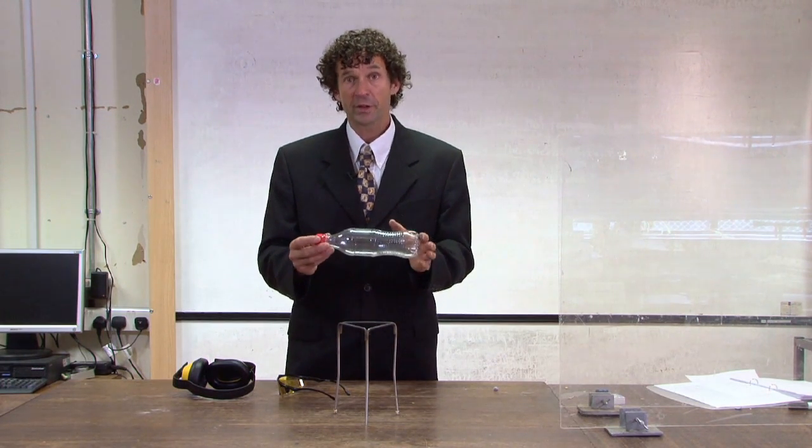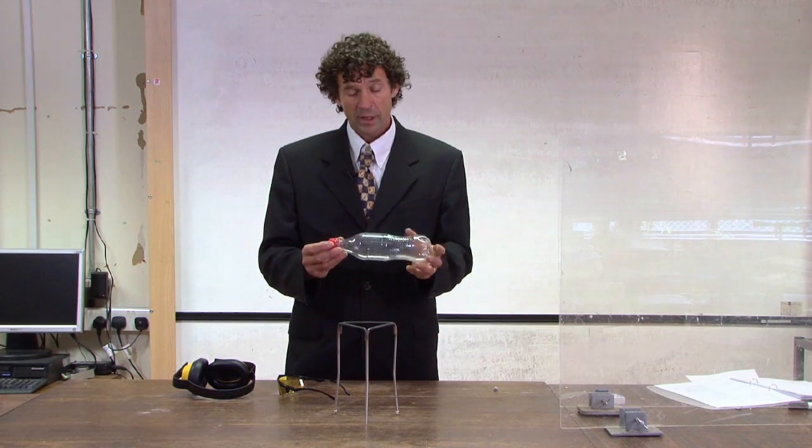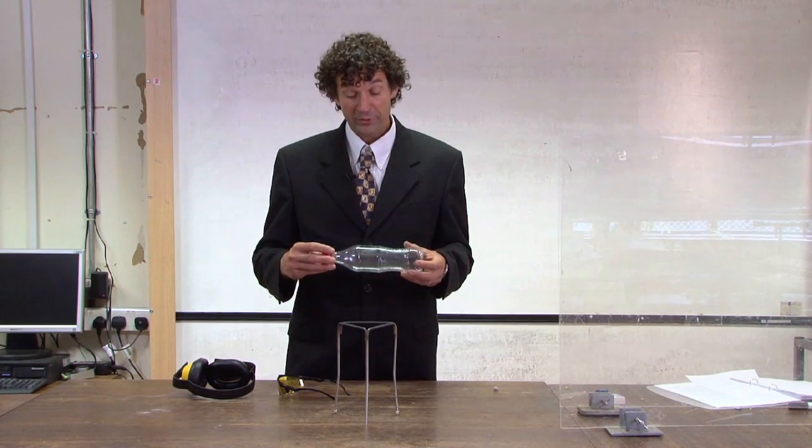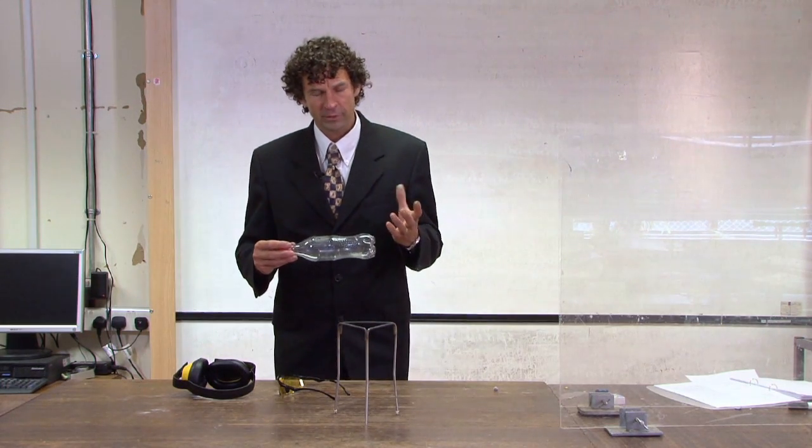The thing about hydrogen is it contains huge amounts of energy. When it's mixed with oxygen and ignited, the product is just water and a lot of energy released.